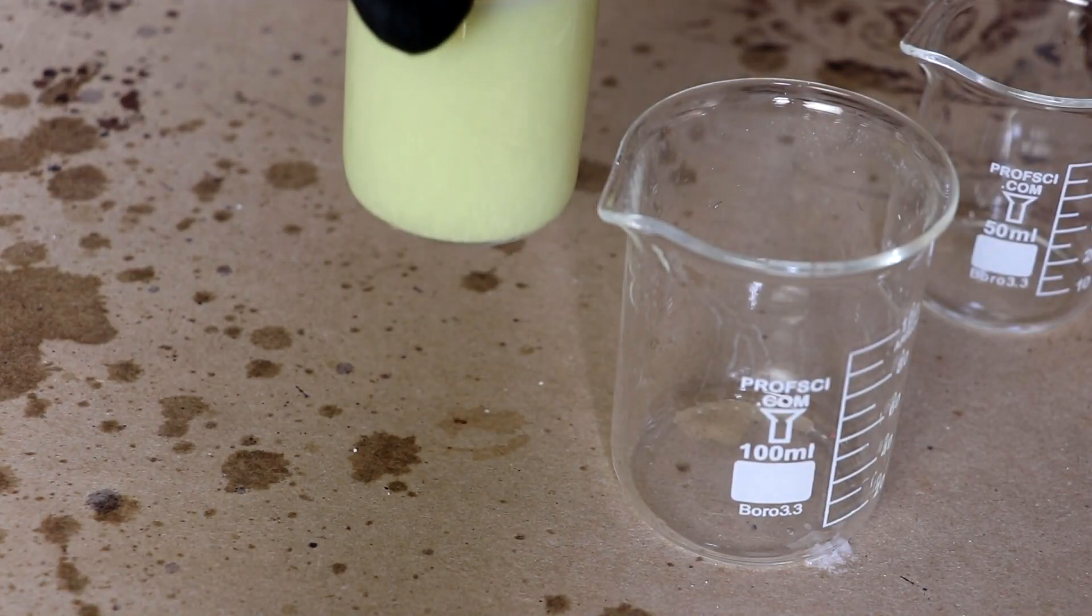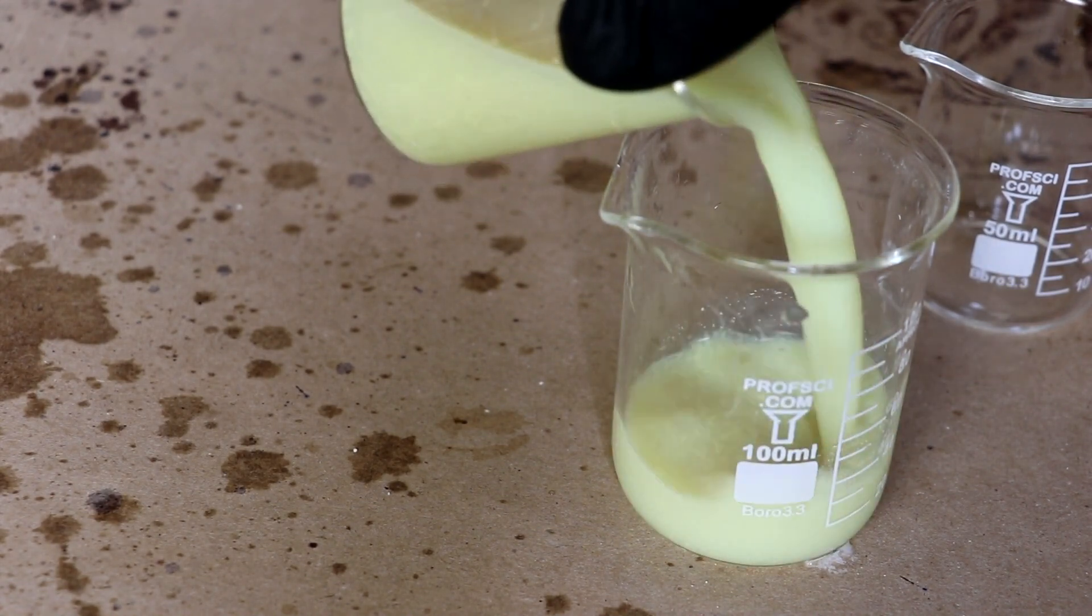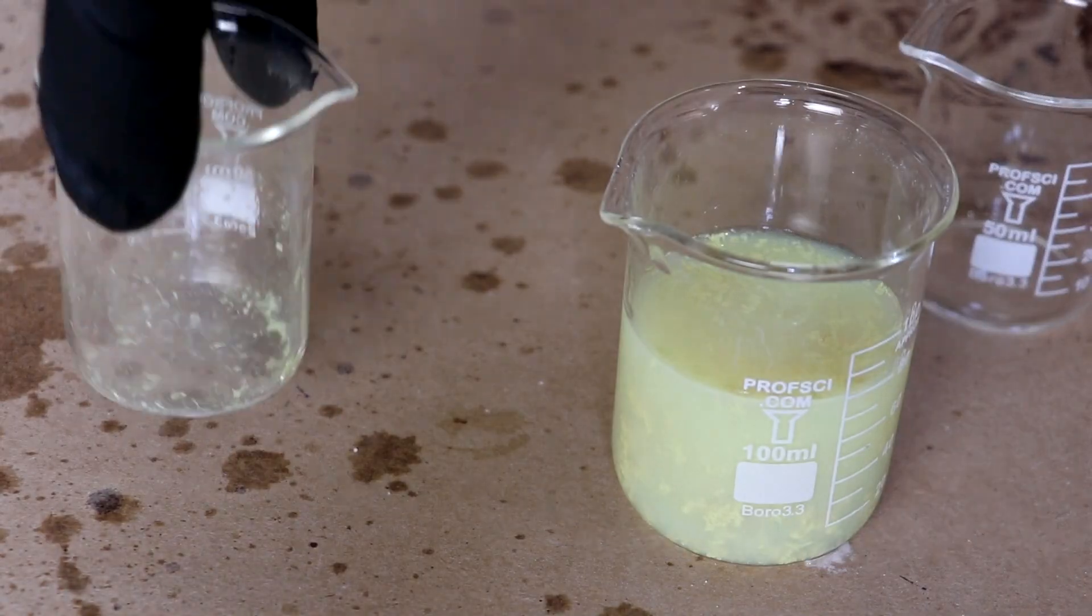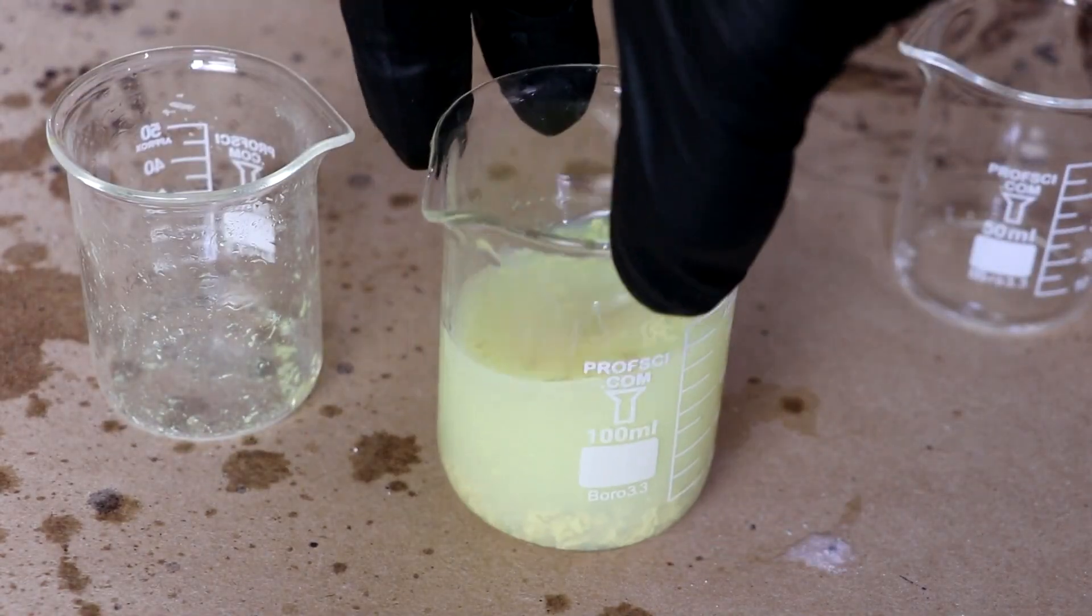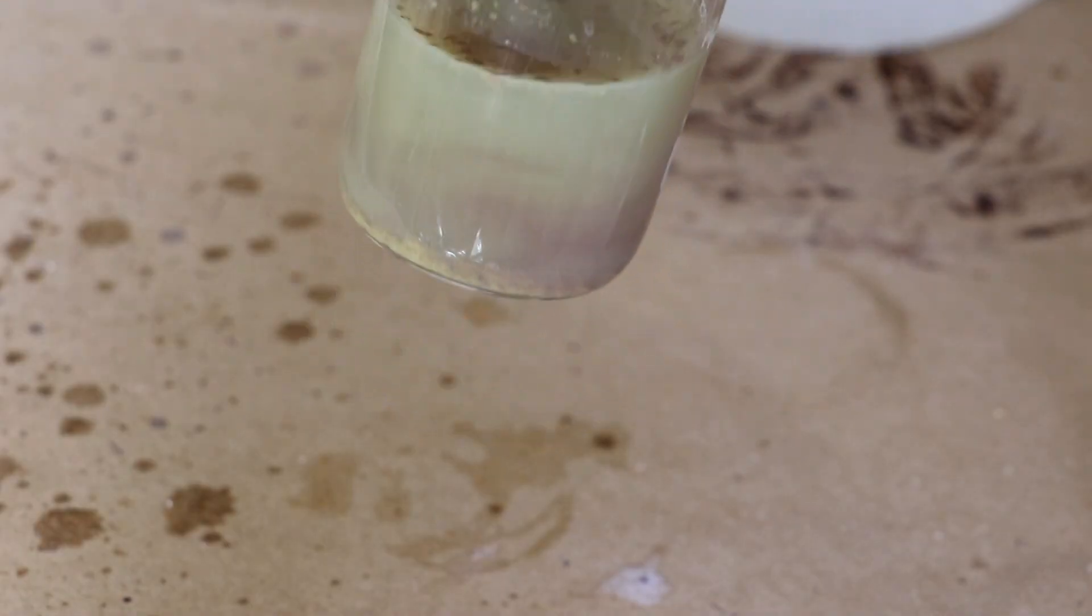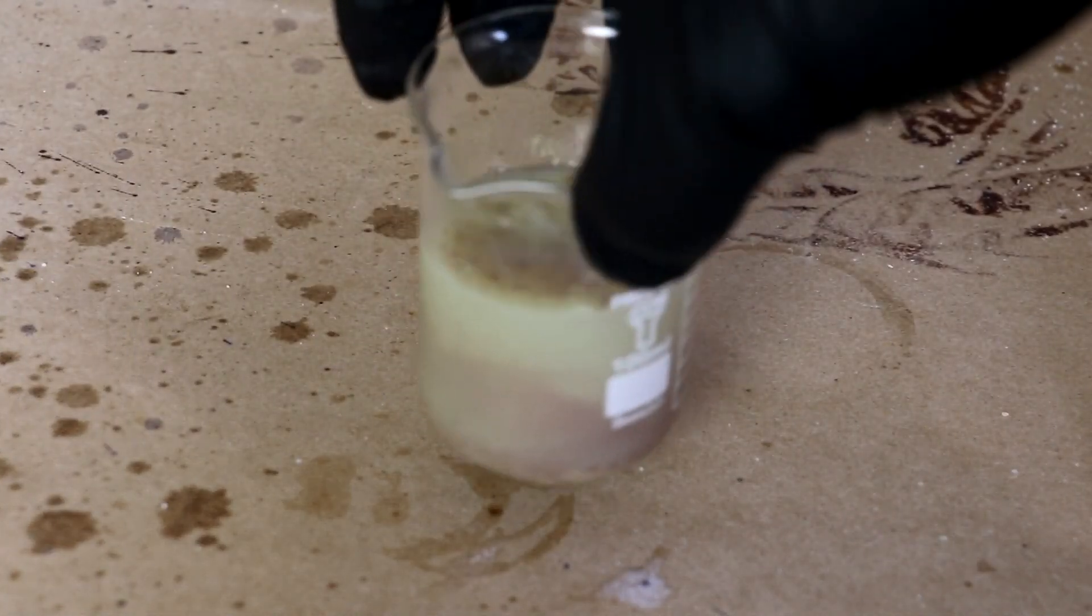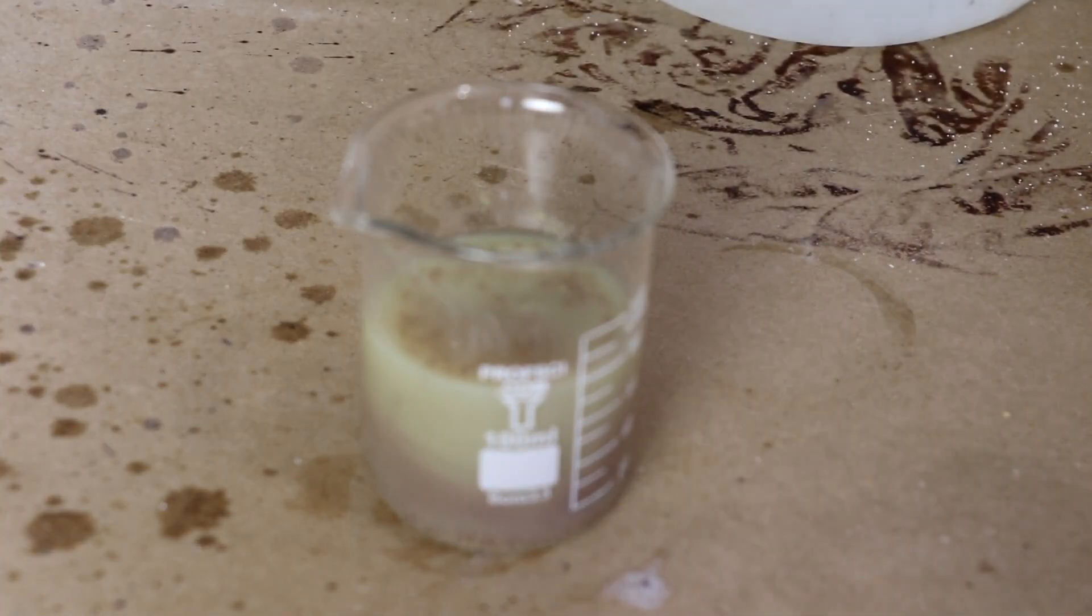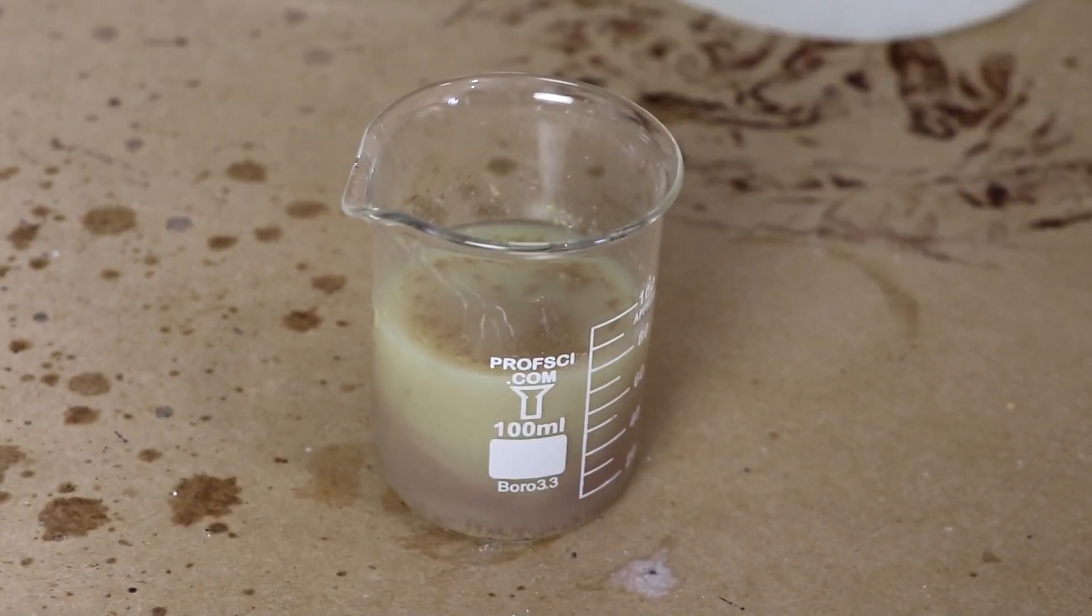It has worked. Let me put this into a slightly bigger vessel here. Yeah, that's definitely iodine. You can see the silver iodide's already started to darken in the little bit of light that I got here. So, let's get the iodide separated from the chloride, shall we?